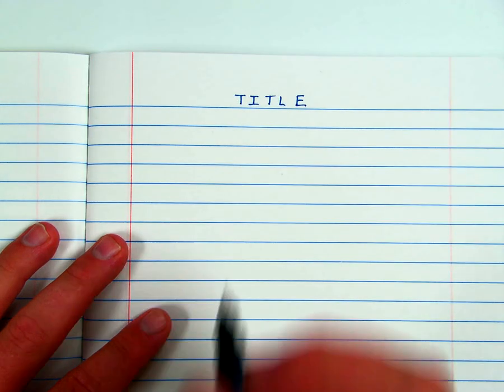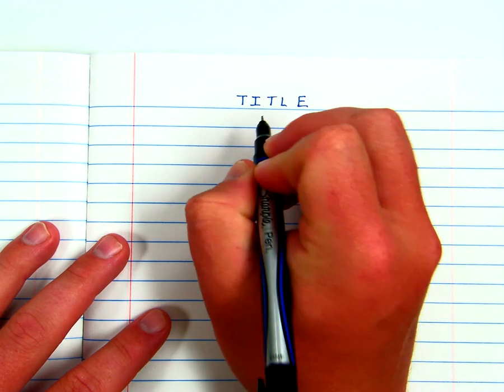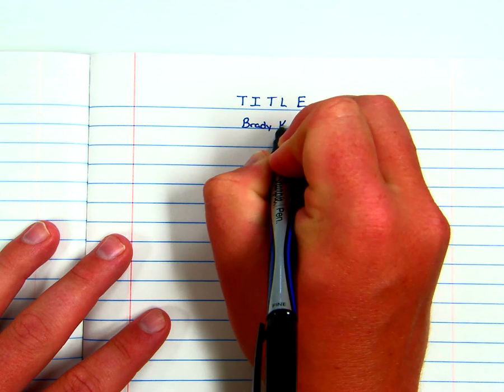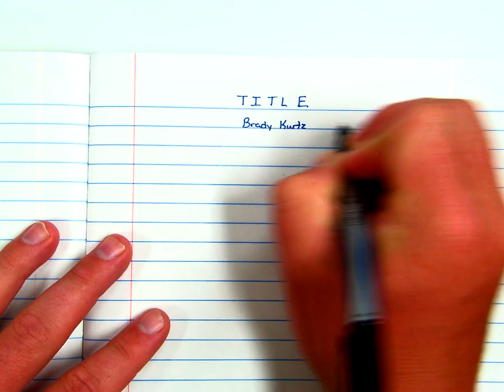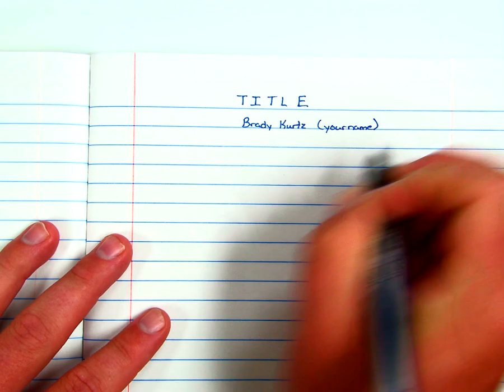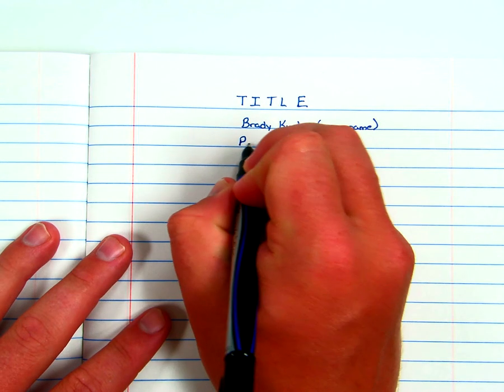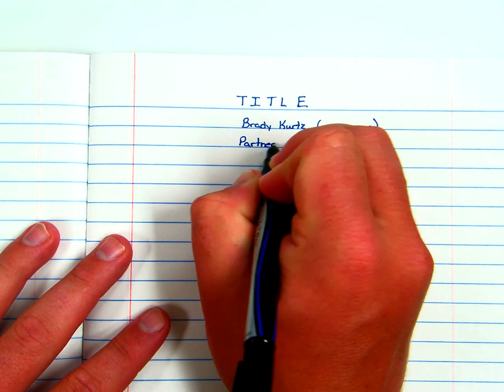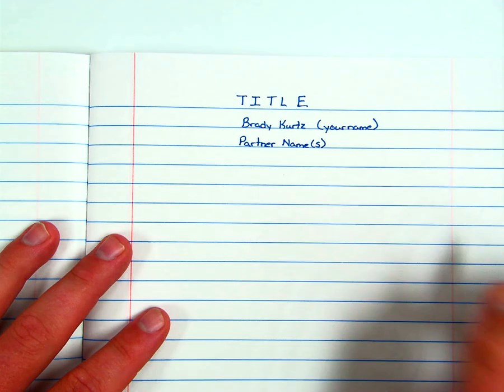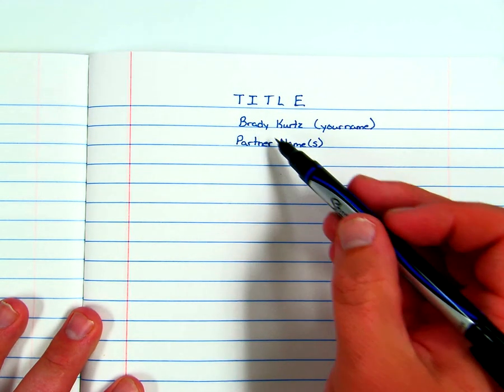After the subtitle, if there is one, you put your name and only put your name. Okay, so obviously my name, you can see there. Okay, so this is your name. Below that, that's where you write any partner's names that you might be working with. Okay, partner, name, or names. The reason that is we want to identify that this is your work by putting your name first, and then your partner's names would go below that.